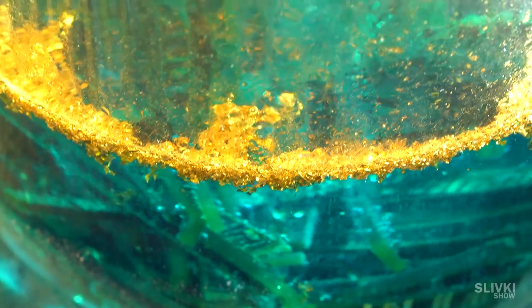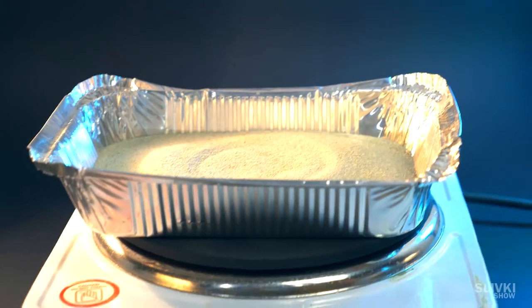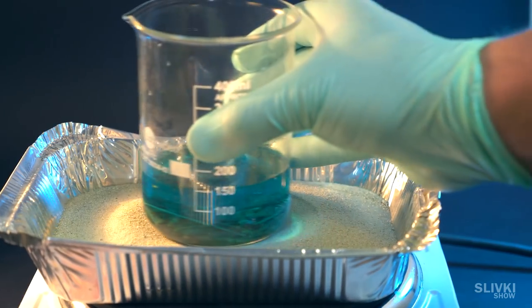When acid is dissolved and the process is slowed down a little, we put the glass on the stove, so it will make a reaction more active.